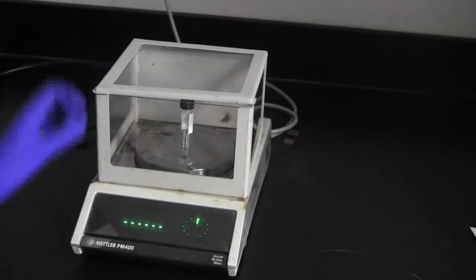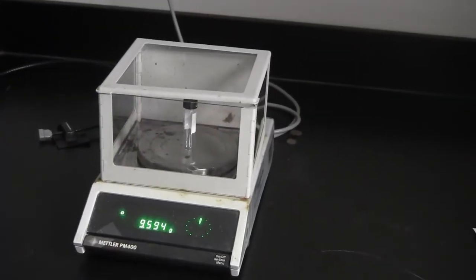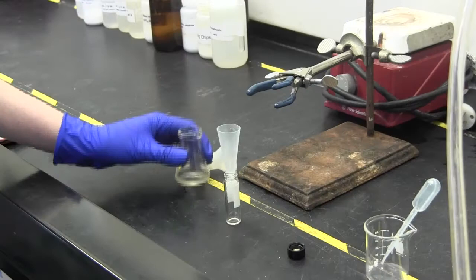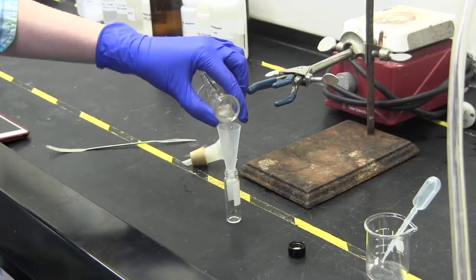To complete this lab, you should weigh an empty vial and record the measurement. Then, transfer the filtrate from the flask to the vial.